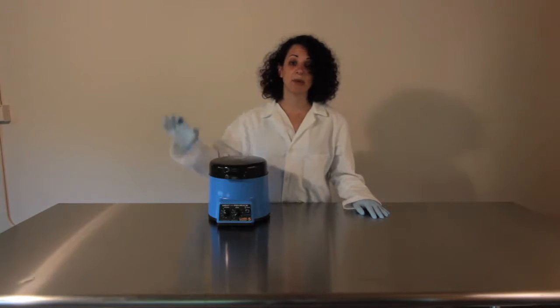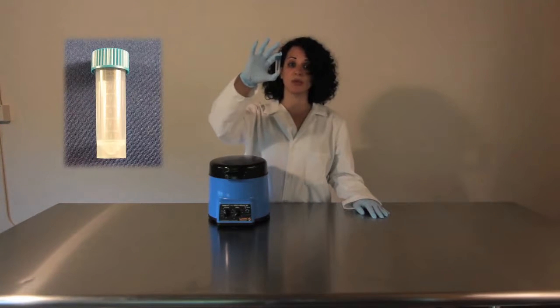Today I'm going to show you some basic guidelines for homogenizing samples in the Bullet Blender 5 homogenizer. This unit homogenizes samples in 5 milliliter self-standing screw cap tubes.